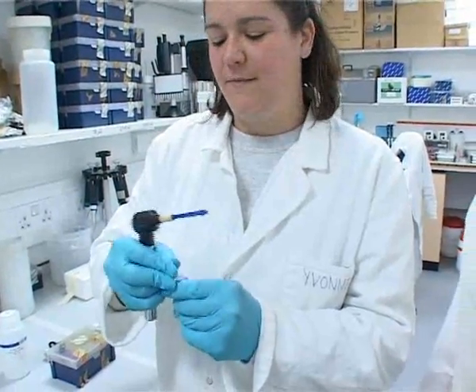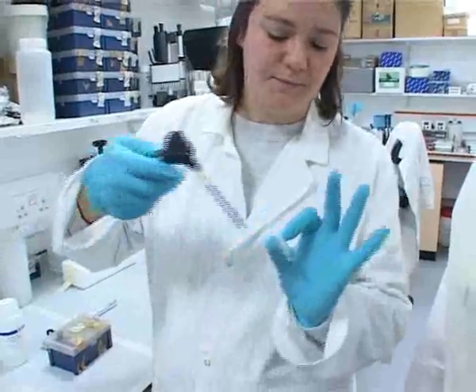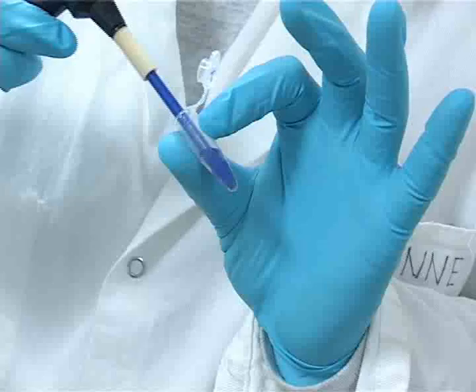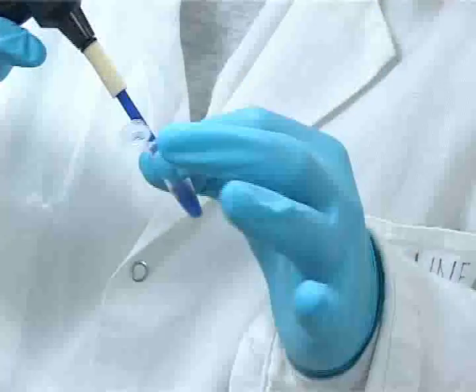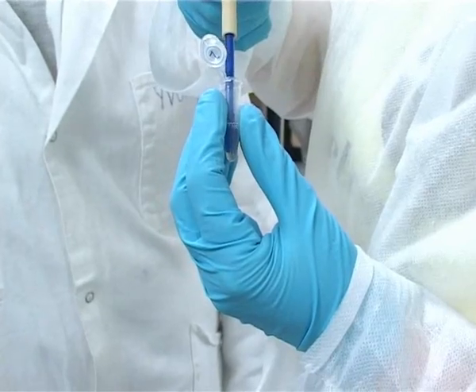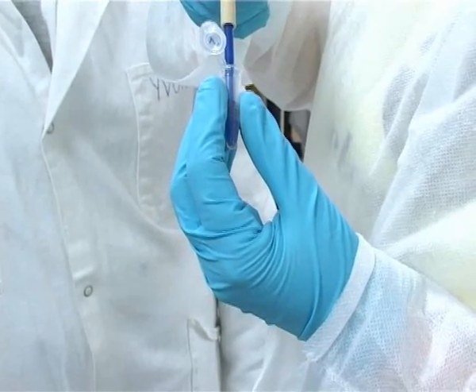In order to get the most DNA out of the mosquito, you actually grind it up. So basically we just put this pestle in here — mosquito soup, yeah basically! Do you want a shot? Yeah definitely. My legs are covered in bites — I'm feeling a good sense of satisfaction here.